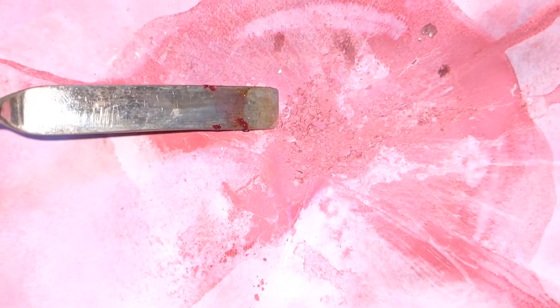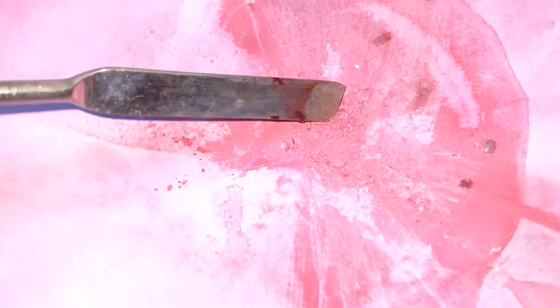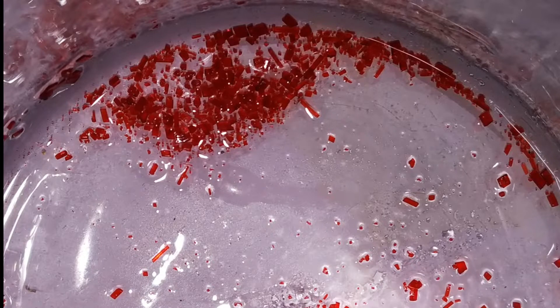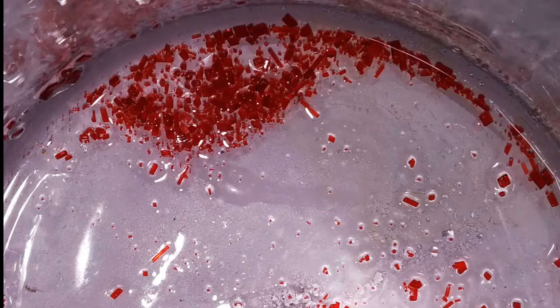This is the dried basic chromium-3-glycinate from the filter paper. The surprising fact is that I had done the same experiment a few days back taking random amounts of reactants, and to my surprise I actually got the red colored crystals. You can actually see the red crystals of chromium-3-glycinate in this picture, but I was not able to capture the video. So yeah, chromium-3-glycinate actually has red colored crystals.